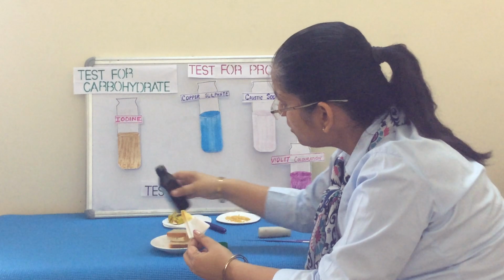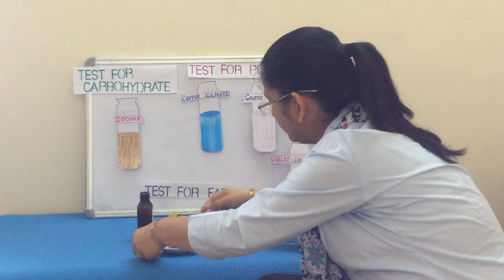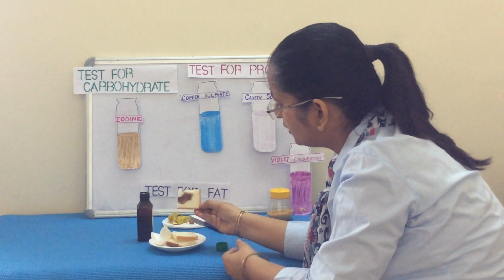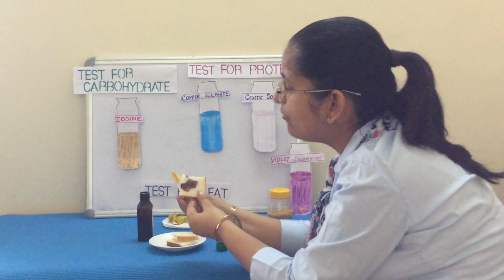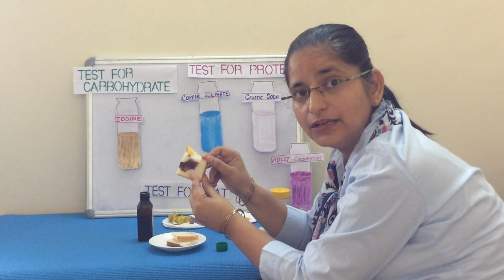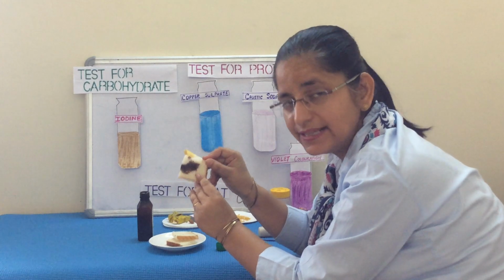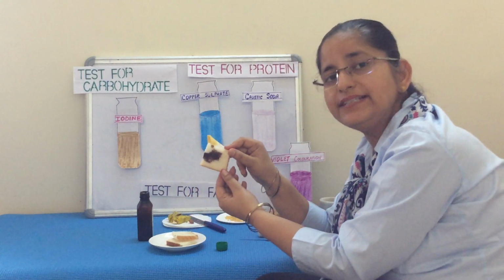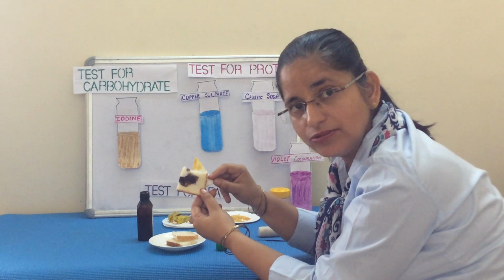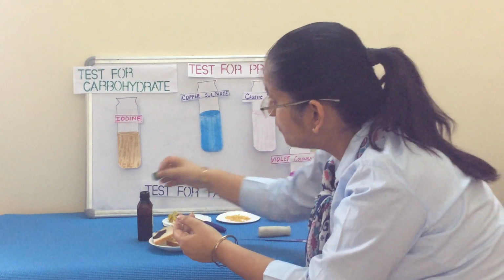However, if I pour iodine in a carbohydrate sample, like I have placed it in this bread sample, what you see? You see gradually the color of this is changing. This is changing to blue-black coloration. So, this is a common test for carbohydrates. That is the test of starch. This is called iodine test for starch, where iodine, when combined with carbohydrate, it produces a blue-black coloration. So, this is a common test for carbohydrate.